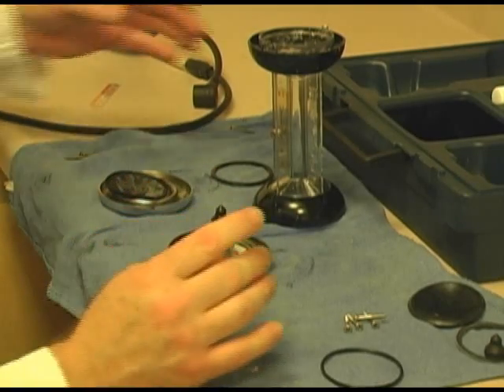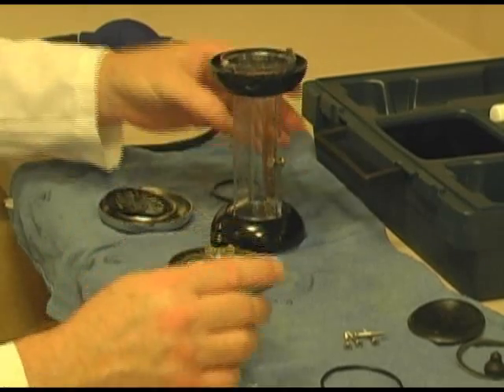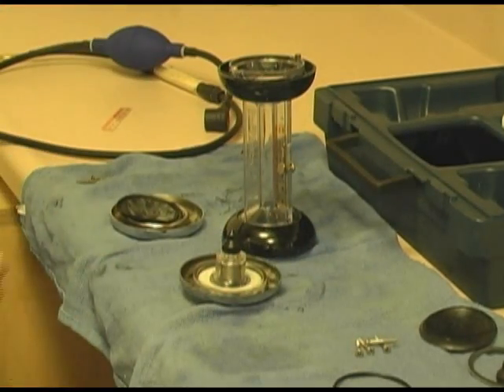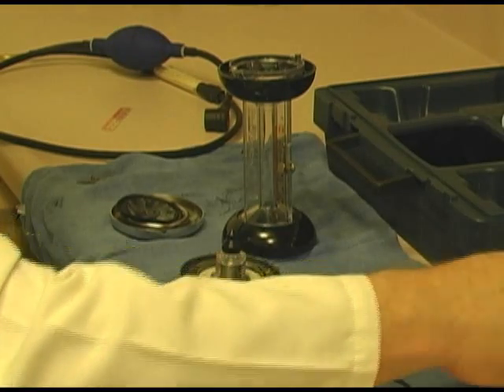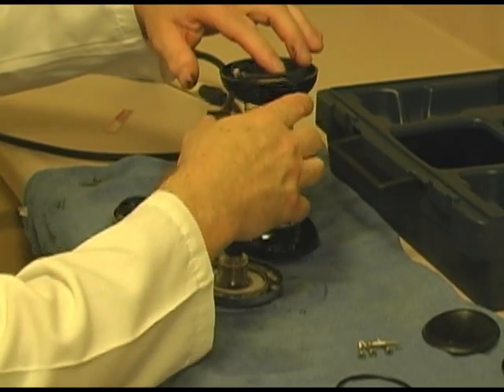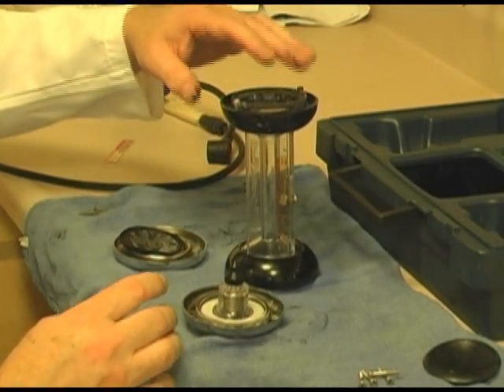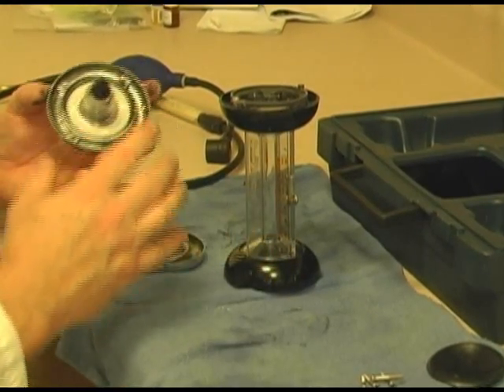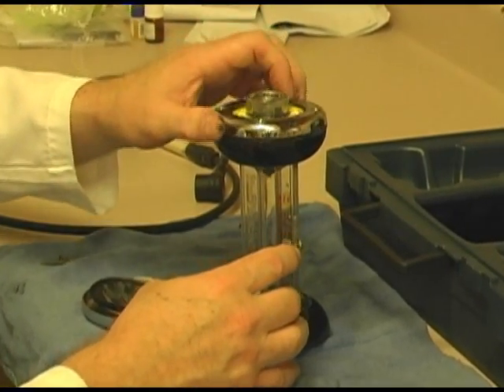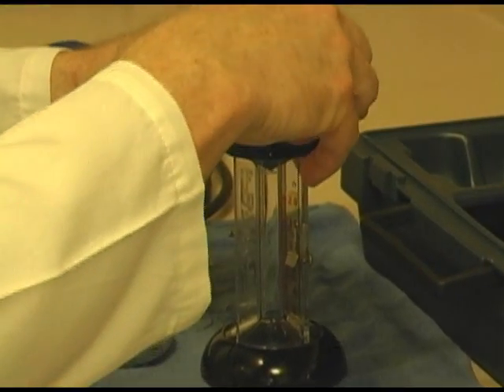Now let's reassemble this top part. I'm going to put my gasket in. Grab a new gasket. Put in the gasket. Nothing complicated. Flops right in there, right into place. And then we're going to put the top back on. Of course, you line up the screws. Not that you can really screw it together wrong. There's nothing you can really do wrong here that I can see.